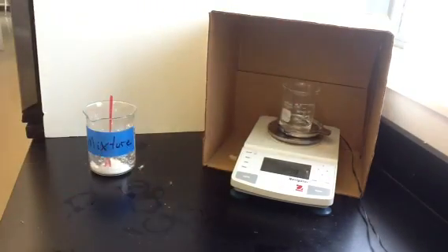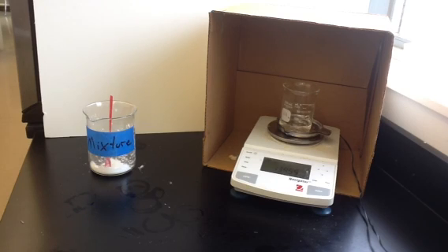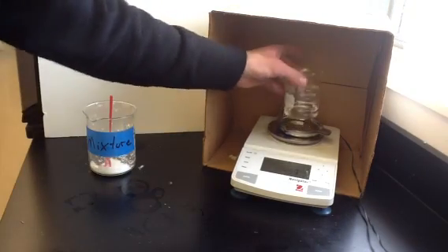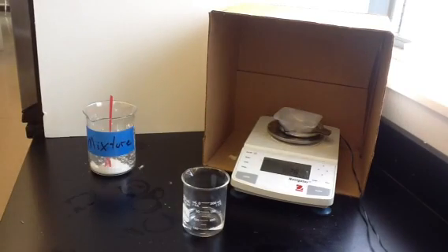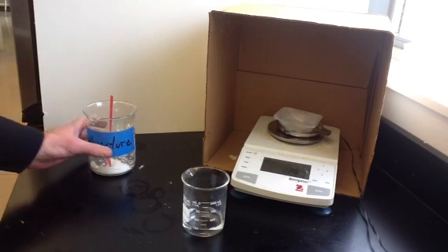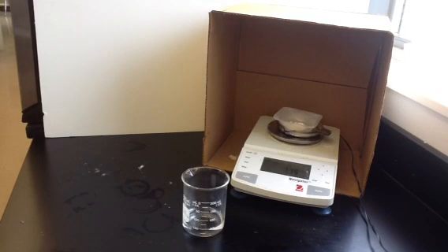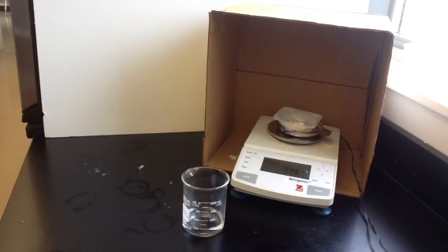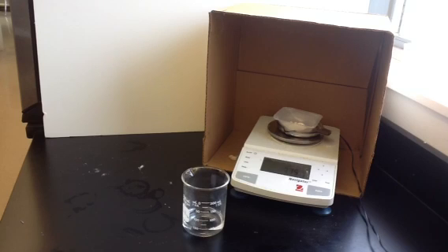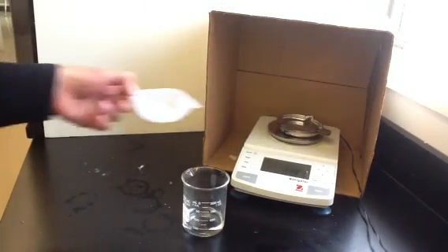We'll start by finding the mass of our beaker and acetic acid. We have a beaker with acetic acid in it, and its mass is 139.55 grams. Next, we'll find the mass of the empty weighing dish — that's about 2.26 grams. Now we'll take a sample of the mixture, which already contains both sucrose and sodium bicarbonate mixed together. Our goal is to find how much of it is sodium bicarbonate. The mass of the dish and the mixture together is 7.75 grams, so we'll need to subtract out the mass of the empty weighing dish.